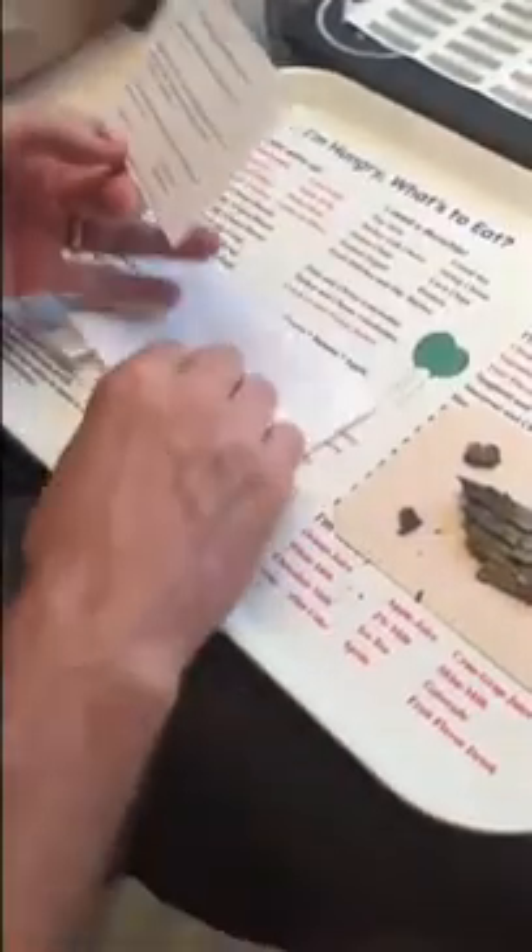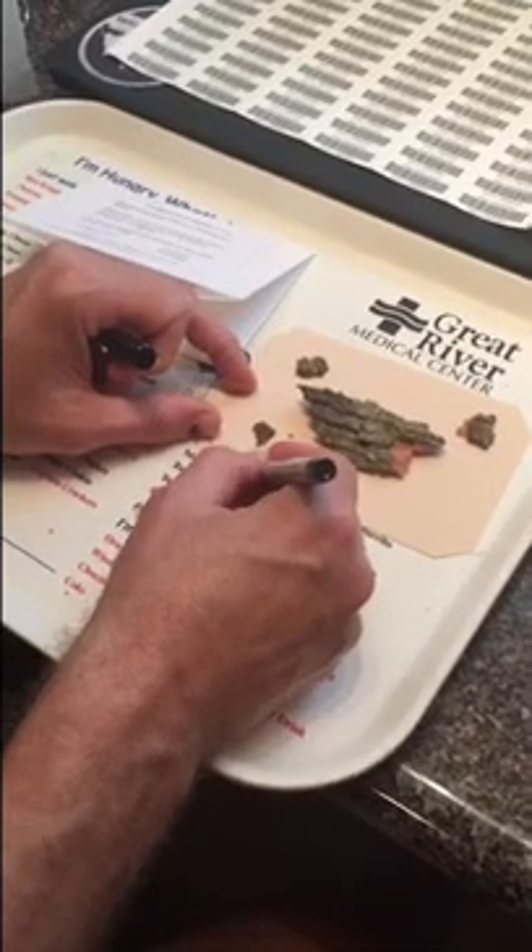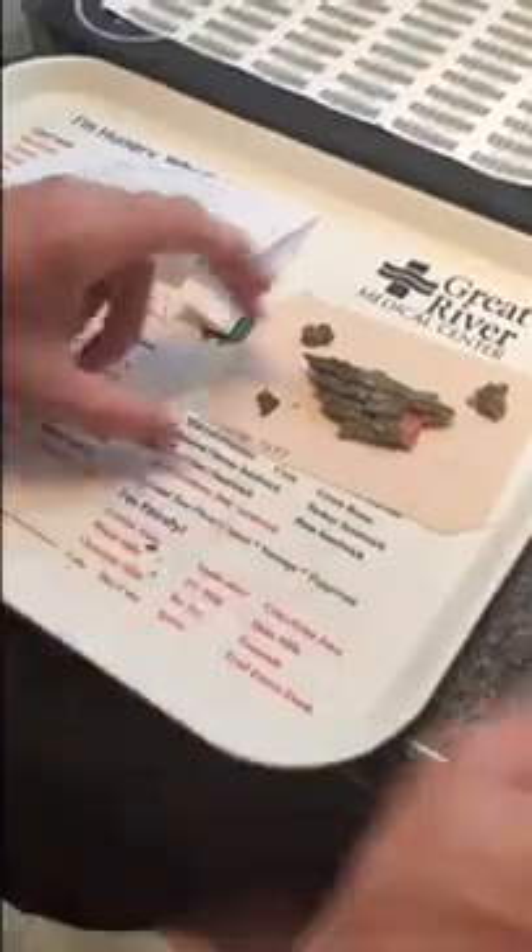That is essentially done. Now I'll glue the label — I put a little bead of glue along the back top of the label, it doesn't take very much, then glue it onto the outer flap of the lichen packet and make sure it gets good contact with the paper. I'll add a barcode label to the packet as well for when we enter this information into the database. I'll also add the collector's name and number to the cardboard so that if this specimen ever gets separated from its folder, they can be put back together and you won't mix up specimens. This is Hanson collection 7237, and our first specimen is done.